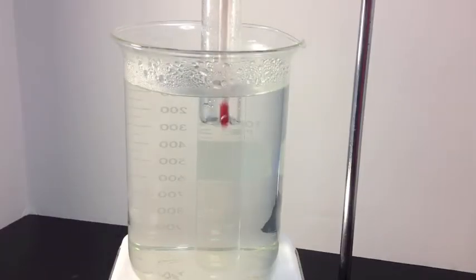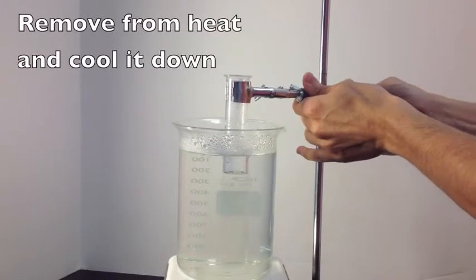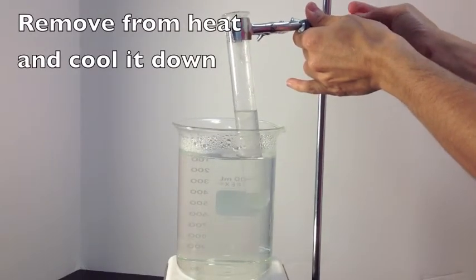And then we just take our unsaturated solution and raise it out of the hot water bath, and then just let it sit.